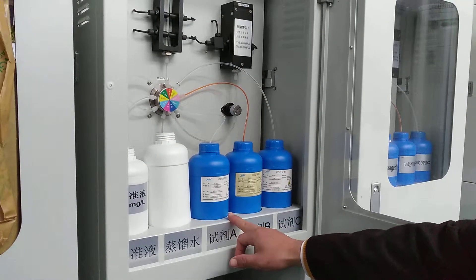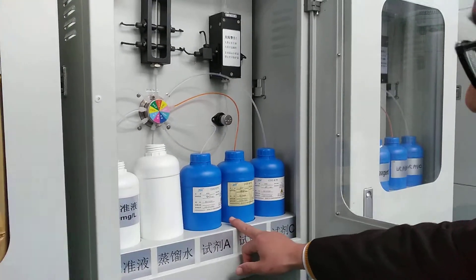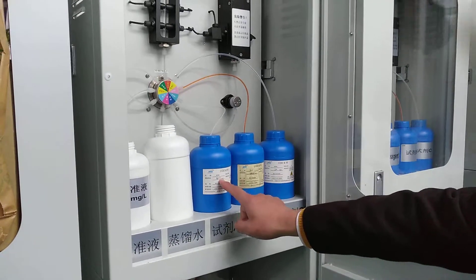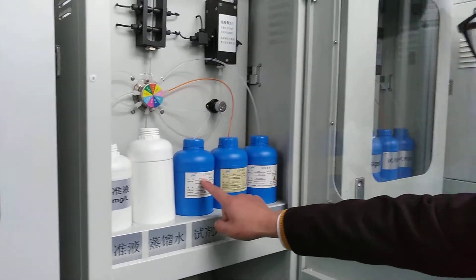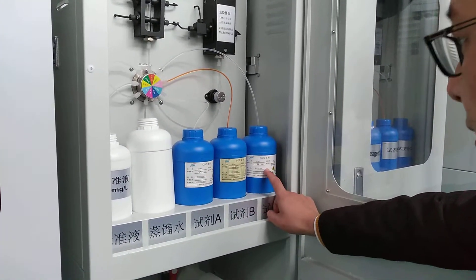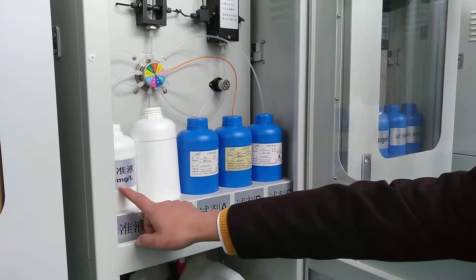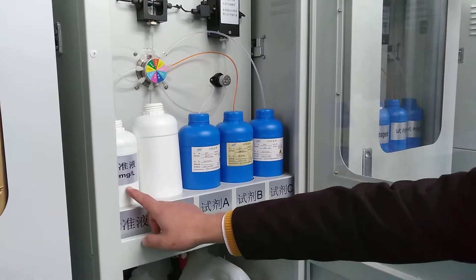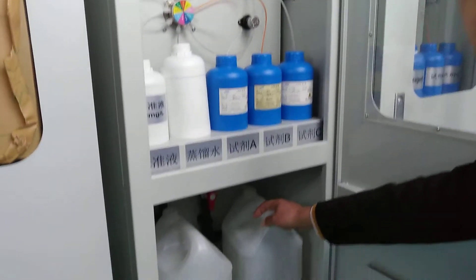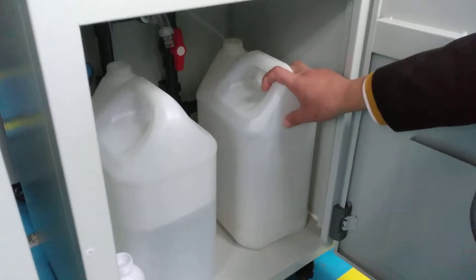Thirdly, if you need the COD-analyzer operation, firstly you need reagent A, reagent B, and reagent C, and standard solution, pure water, and this water is for waste water.